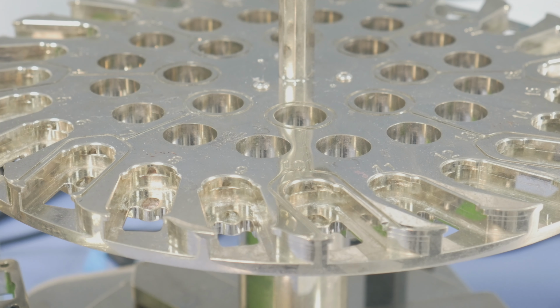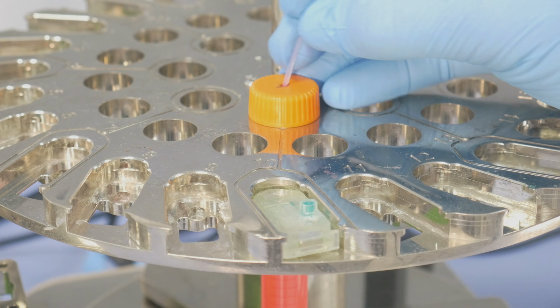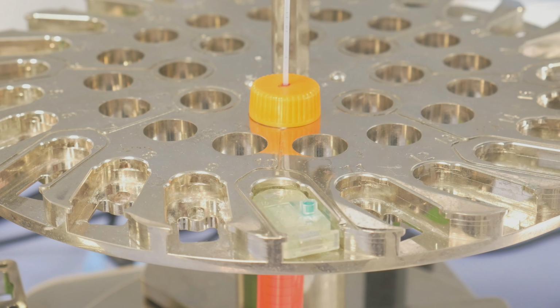To load the deck, you can load the falcon with your source liquid, attach a chip, and then connect the liquid to the chips using the plastic tubing. The high volume tubing is green and the low volume tubing is transparent. If you've only got a small volume of your reagent, you can take a pipette tip containing your sample and attach it to the chip, and finally add your output plate.